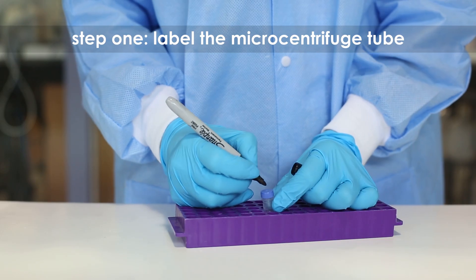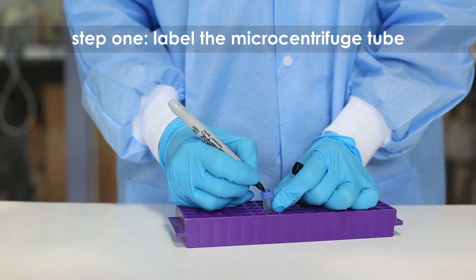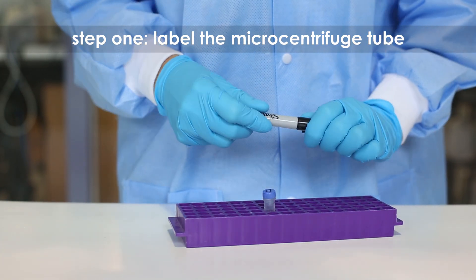Step 1: Label a 1.5 ml screw top microcentrifuge tube with your initials.